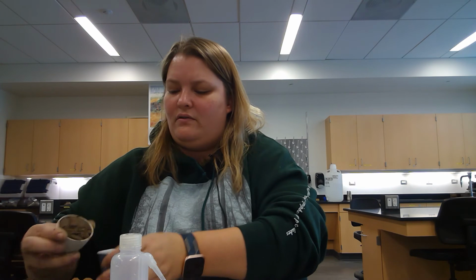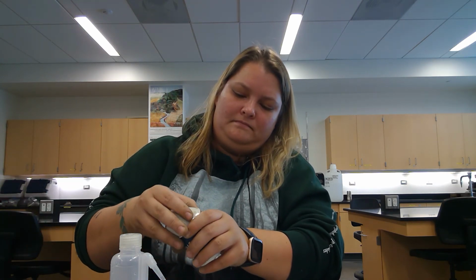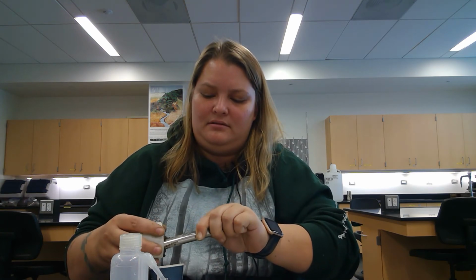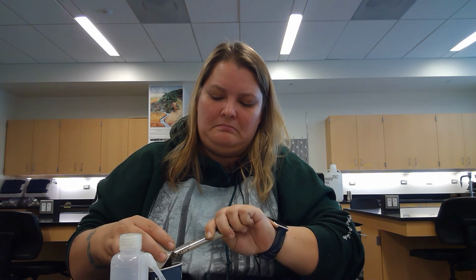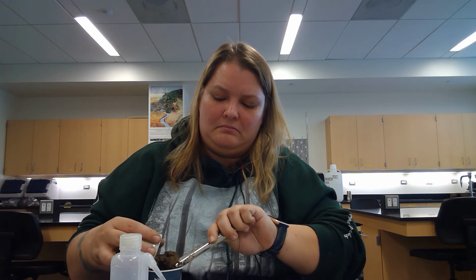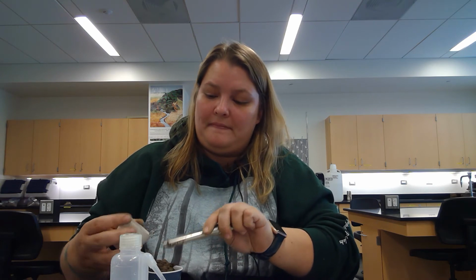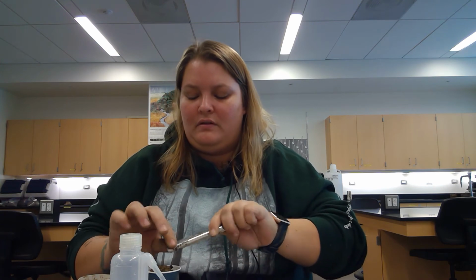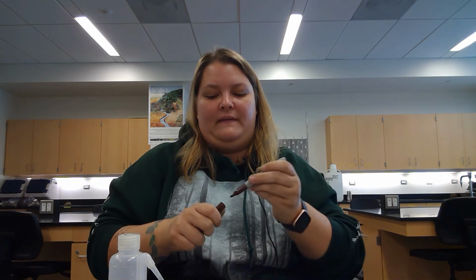And transfer that over. Just doesn't like to transfer over. All right. That's that cup. All right.